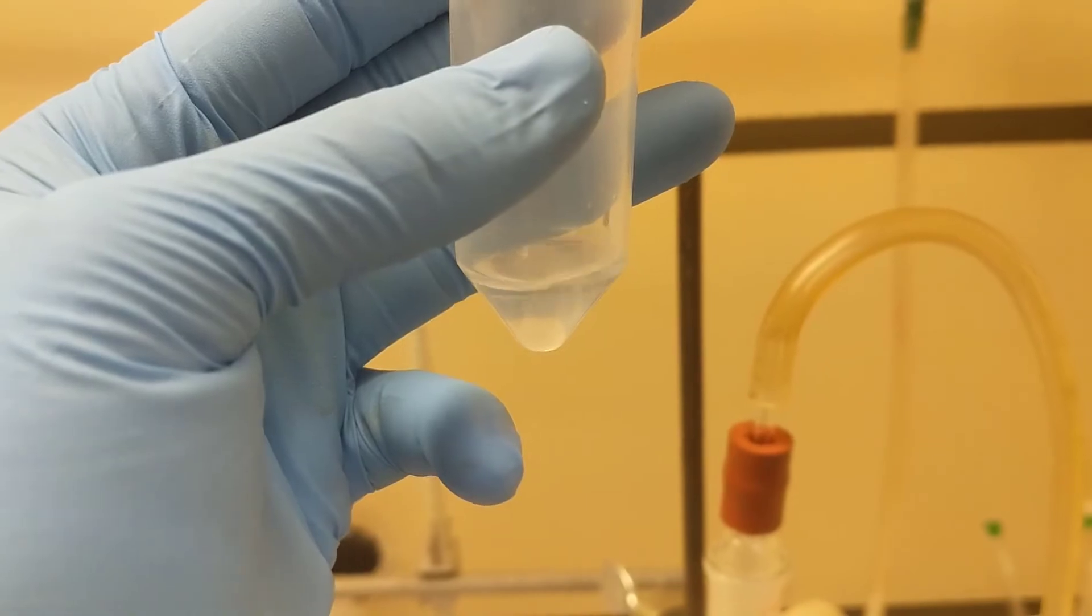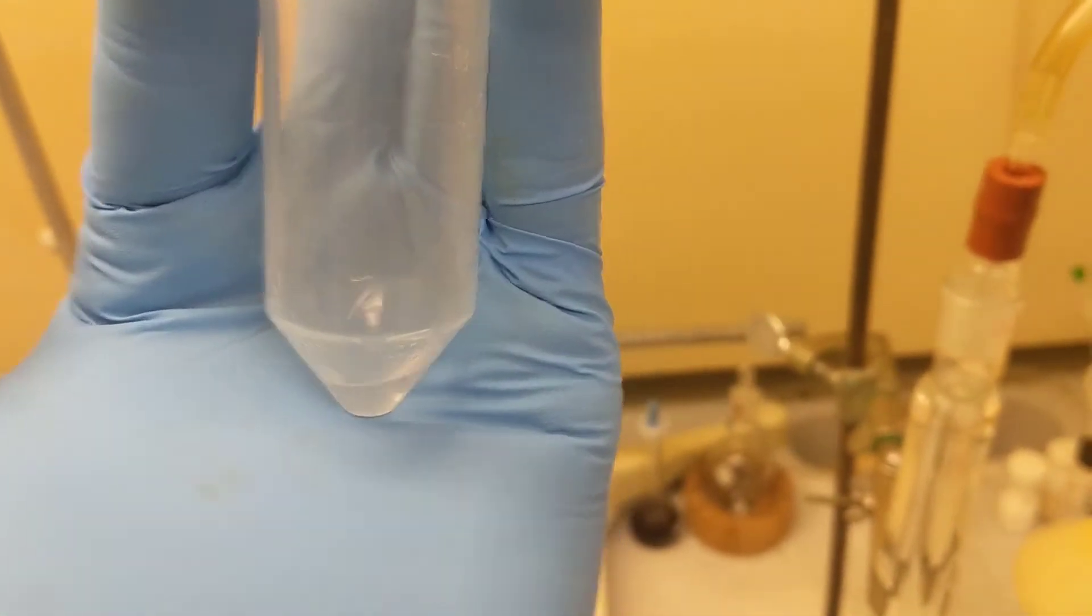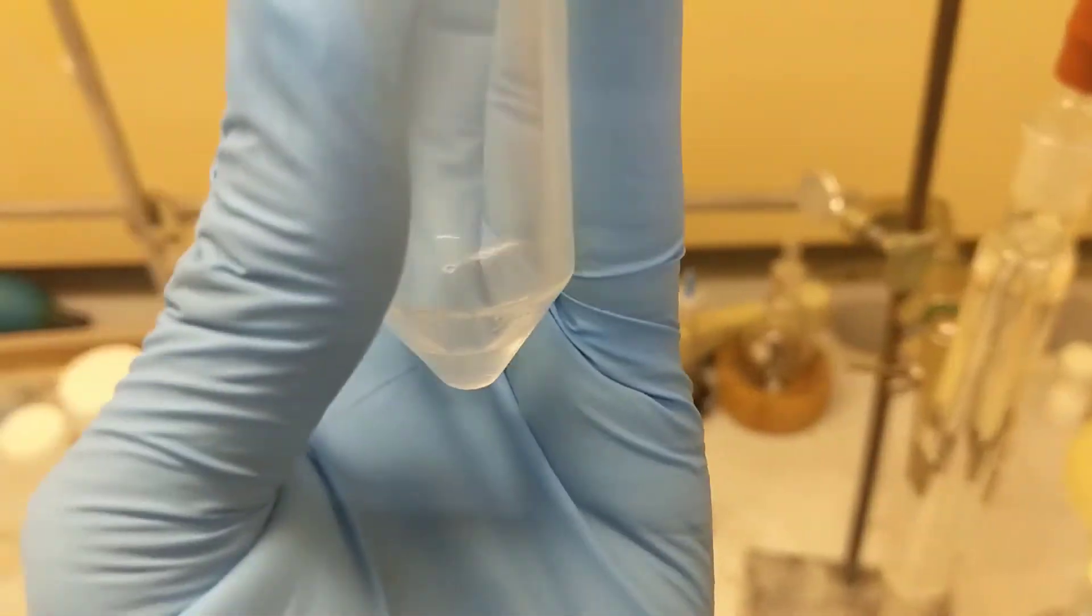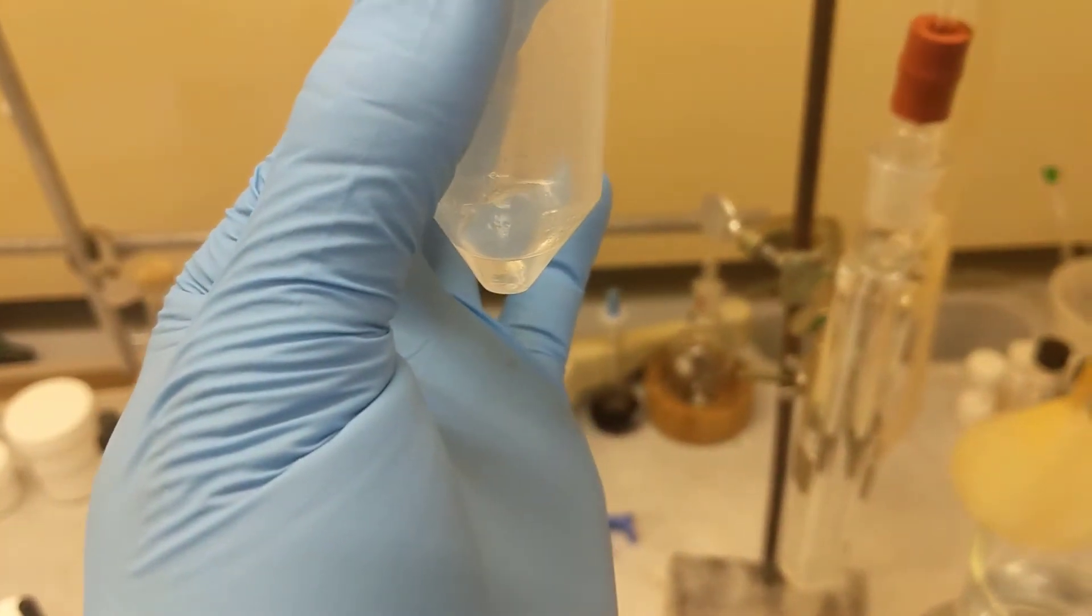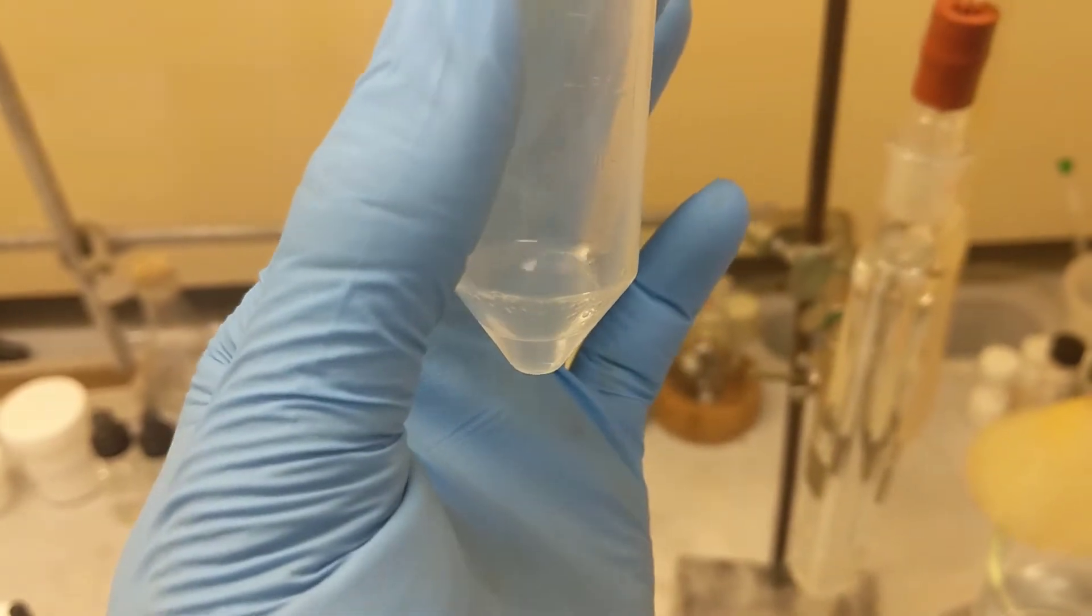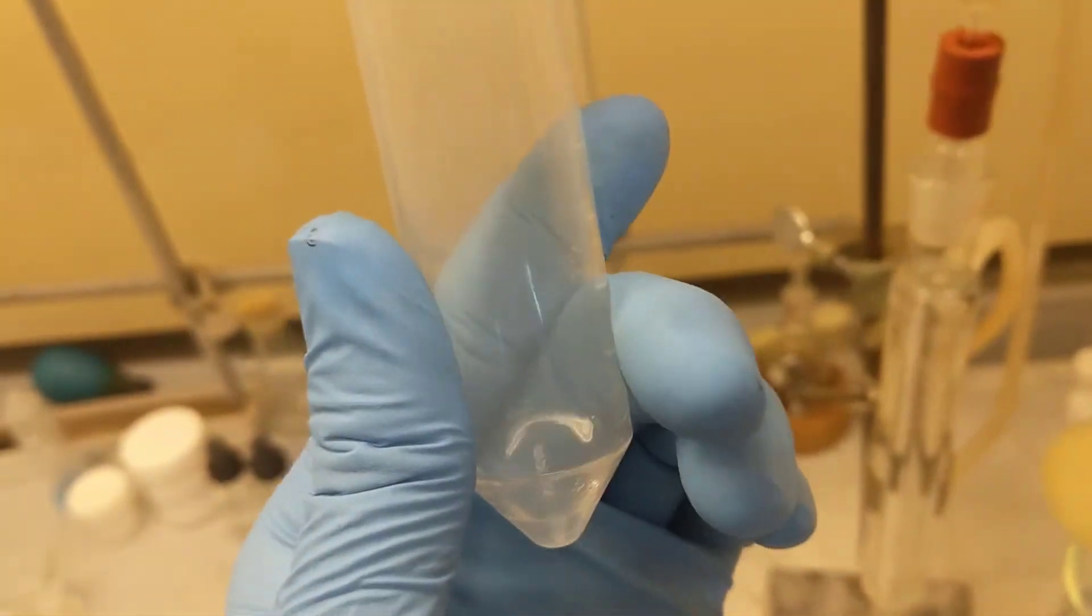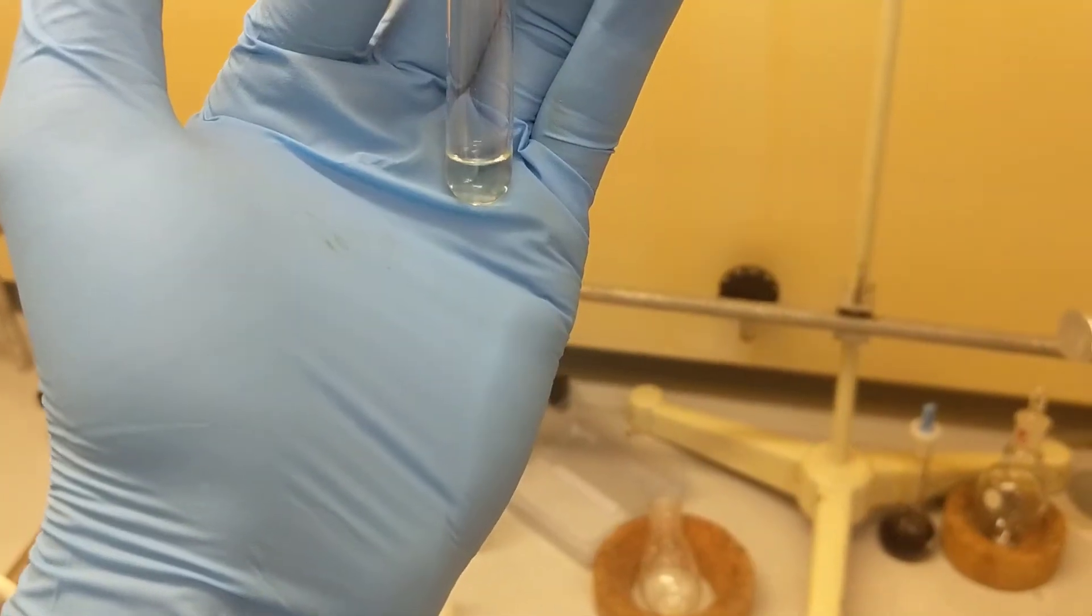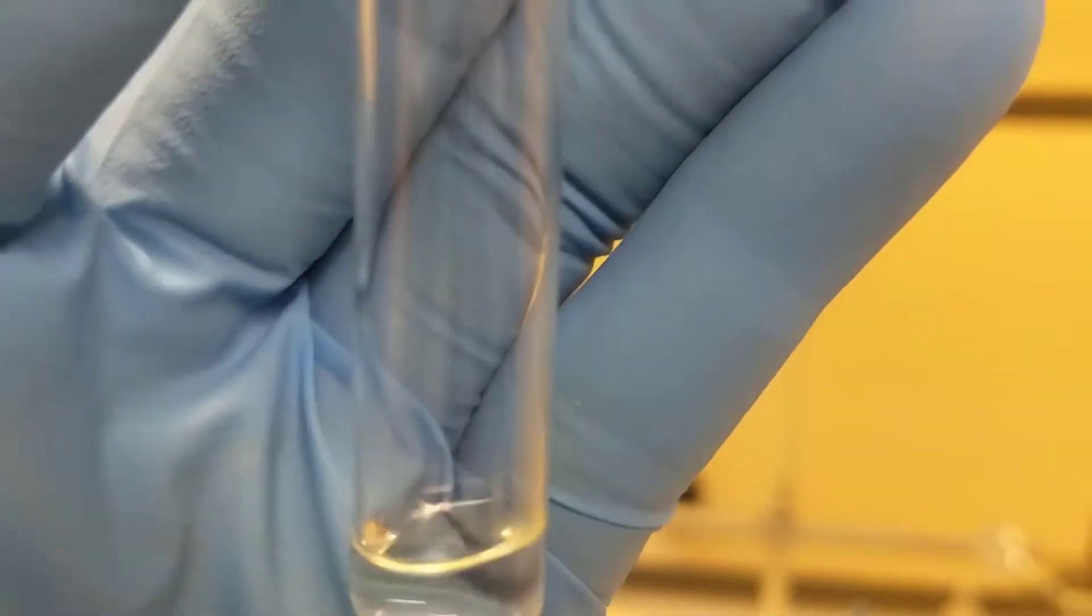This is it after I added the water. You see the two layers. I probably added too much water, but I'm just going to pull it out now. I added a milliliter and a half of sodium bicarbonate saturated solution. You can see it there at the bottom. I'm just going to shake and pull that out. I have done the water extraction and the sodium bicarbonate extraction. Now this is just my organic layer. Now I'm just going to dry this really quick in a test tube, then put in my vial sample, and then I'll finally be done with 20A.